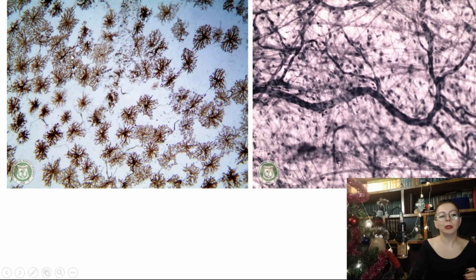And then also pigment cells, also a unique specimen, and you can see it here. They are brown in color and star-shaped. I think they are very unlike others. They are always brown in color, so even by the color you can distinguish them from all the other specimens.